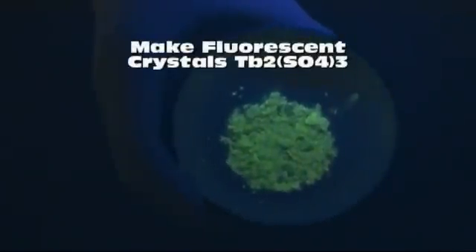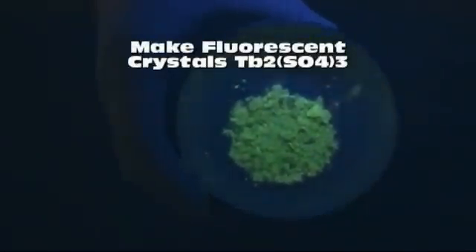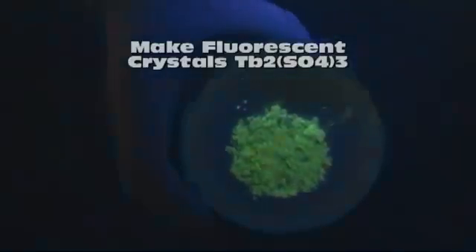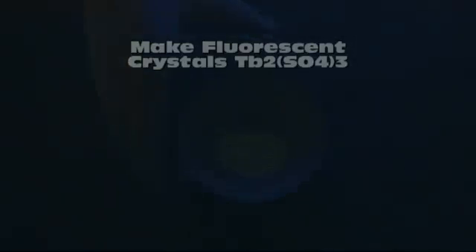Hello again everyone. In this video we'll be making fluorescent crystals from the rare earth metal terbium. These crystals unfortunately are not the persistent glow-in-the-dark crystals, however they do glow very bright under UV.